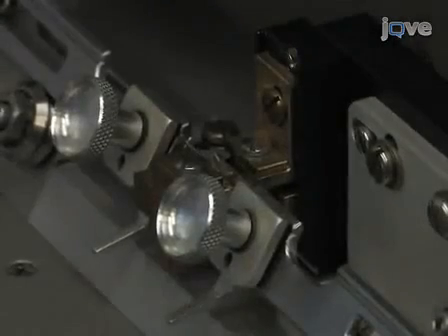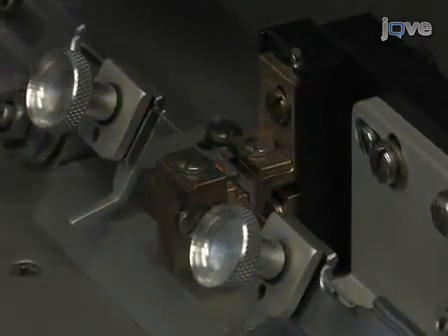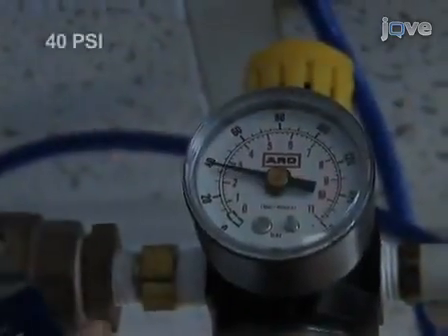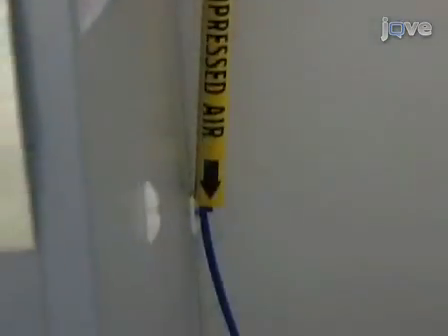Pull a set of 6 to 10 patch pipettes. Consult a local expert or our visualized experiment making patch pipettes and sharp electrodes with a programmable puller for help. To begin the procedure, set a compressed air line pressure to about 40 psi. Then connect the compressed air line to a 4-way control valve.